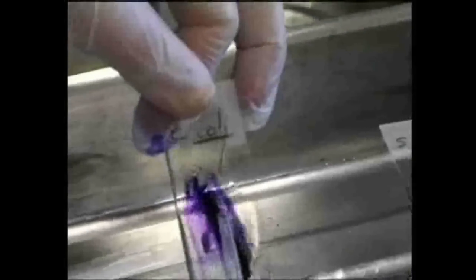Now wash the smear with 95% ethanol. You should do this quickly, until the run-off is clear or a pale violet. When you've reached that point, immediately rinse the slide with water and place it back on the tray.